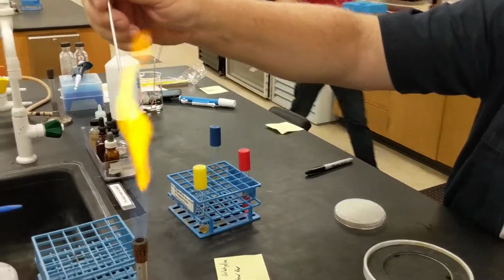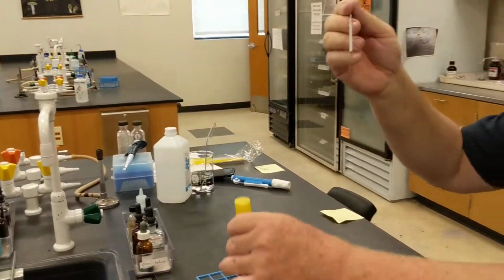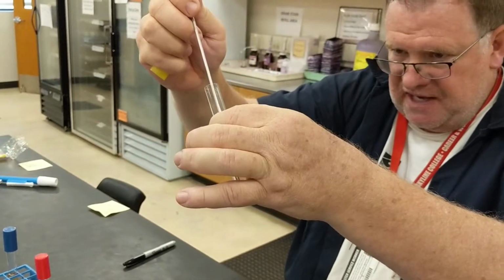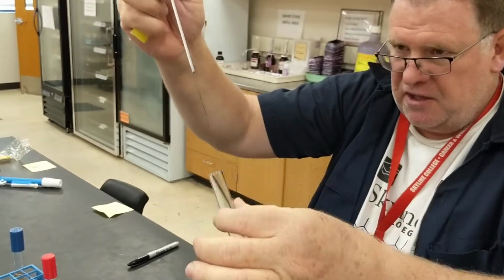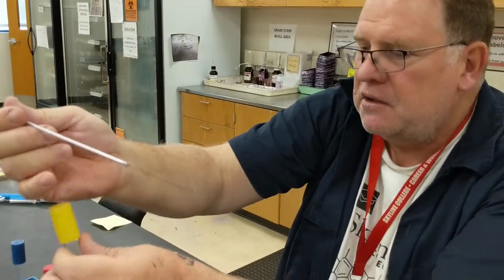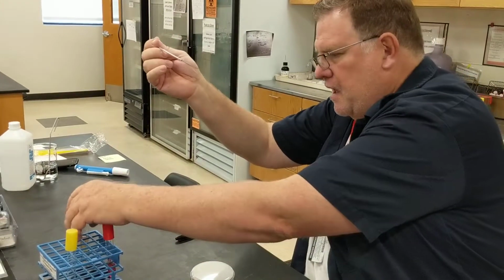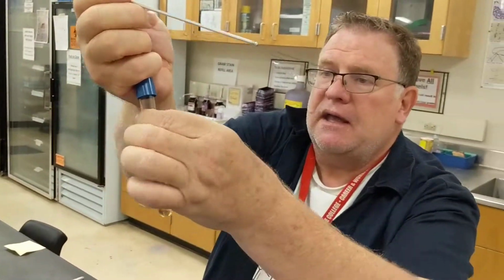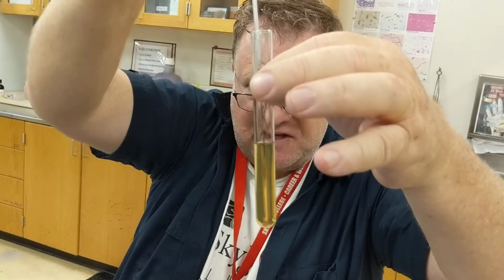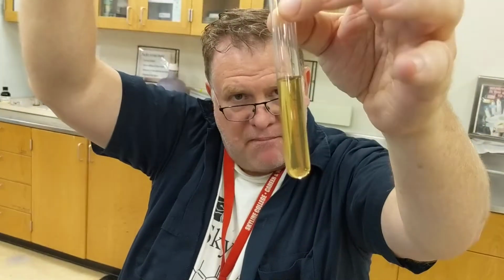So I'm going to sterilize this loop. Then I will go through and get my culture, trying not to touch the sides. I make sure that I get a little bit of culture. I always look on my loop and see that I have a little bit on there. I'm going to put this back. Then I'm going to go on my culture, and I'm basically going to do a stab, just go down and up. And so I made the stab.